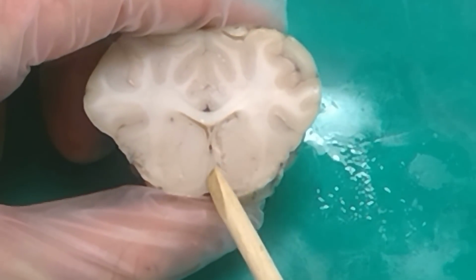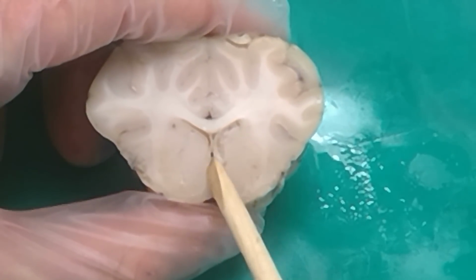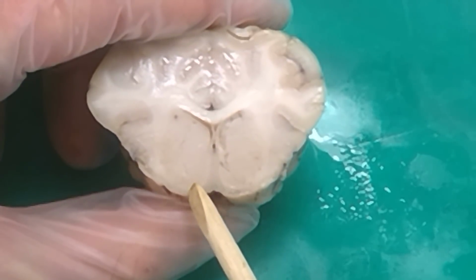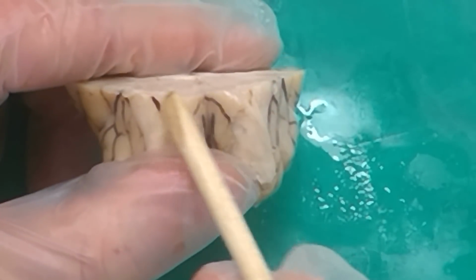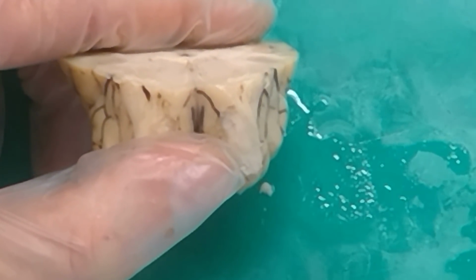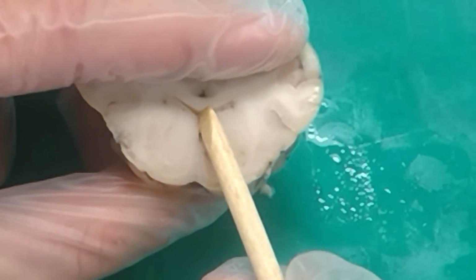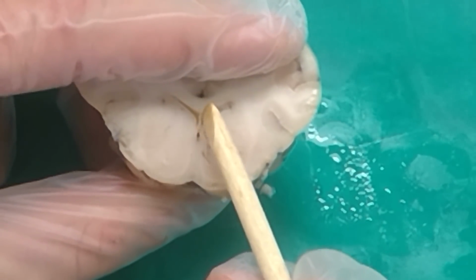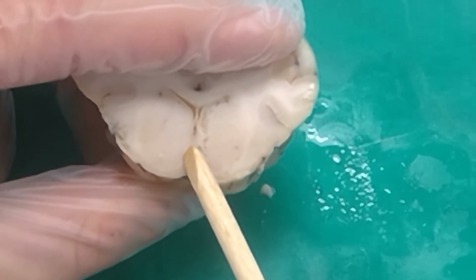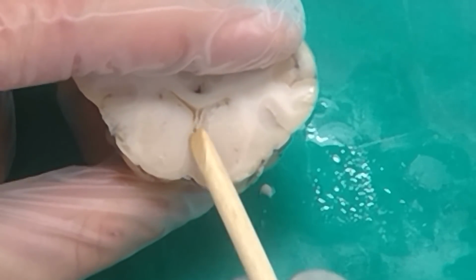So this is the septum right here in the center. You can see a white line going around that's separating the caudate from the septum. And you can see this tissue is continuous going around here with that anterior perforated substance, which is that part that's in the front of the optic chiasm. The septum is below the septum pellucidum. Yes, the septum pellucidum is the membrane, that's this thing right here. And if you follow this down, then now you've got this tissue of the septum where there's this white line right here that's separating the caudate from the septum.